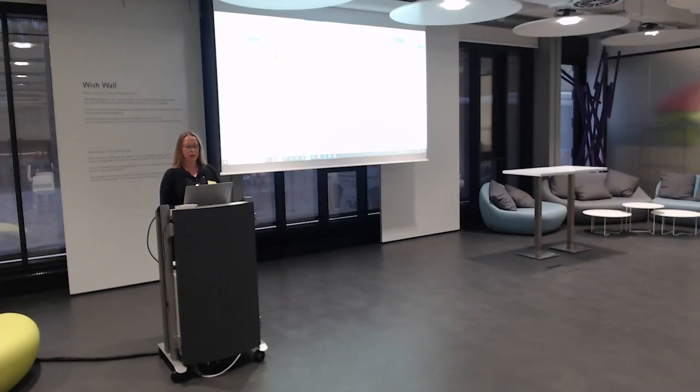It goes back and brings me my unique identifier within the system, which is hyperlinked and gives me all the information that has been implemented. And I think that's really taking Signals a step forward in this way of working. And now I have prepared this. Now I could maybe send the task to somebody to couple it with my biological entity if I would like to do so.